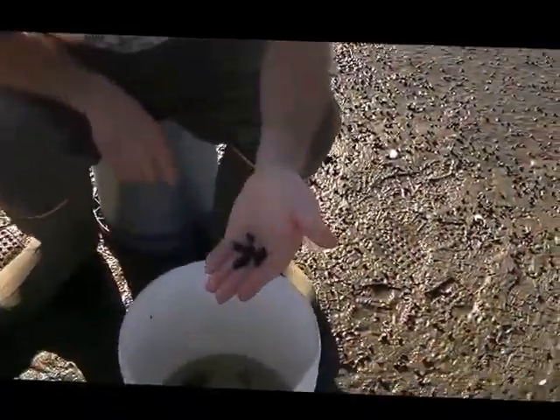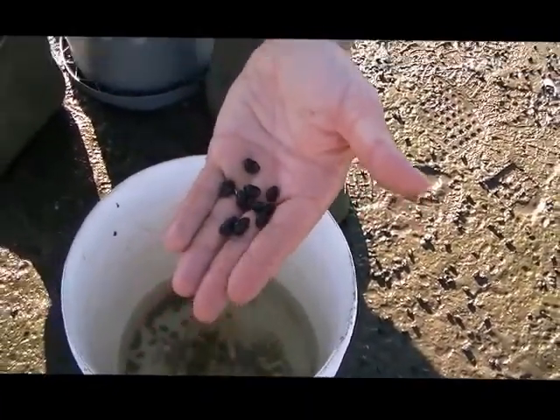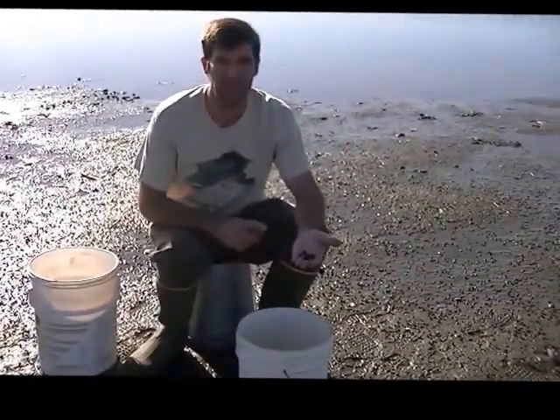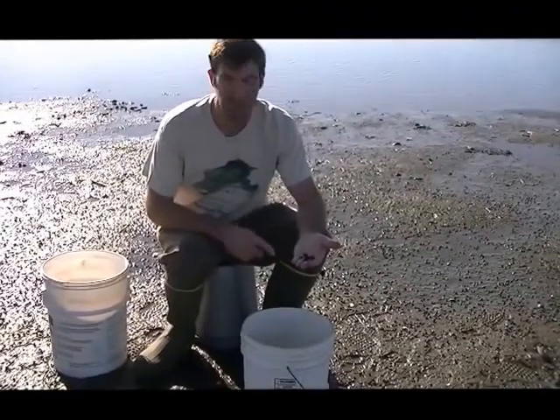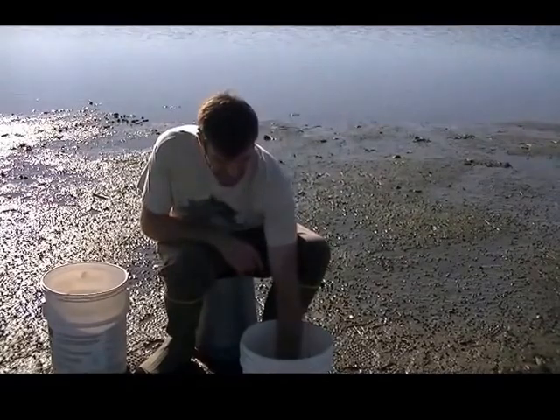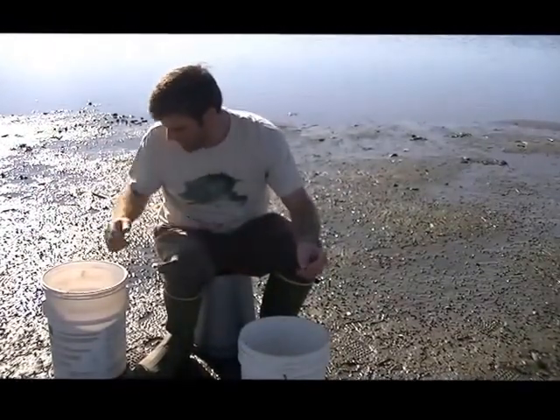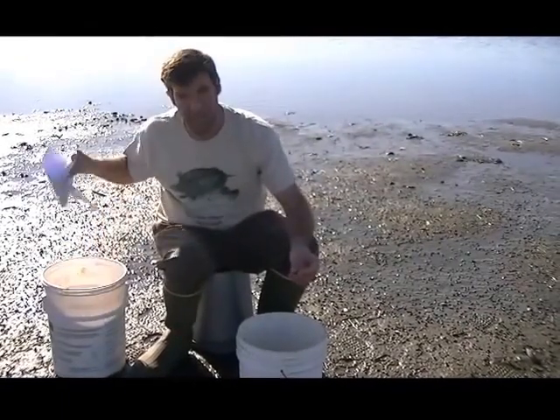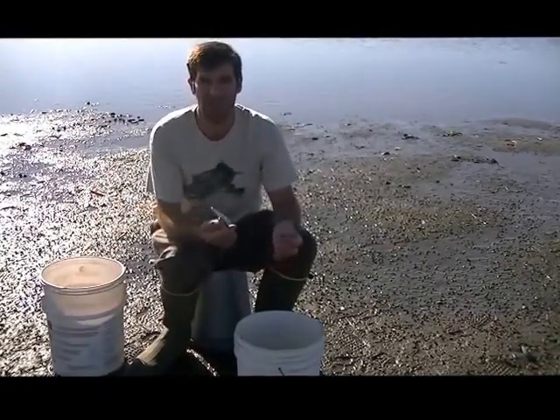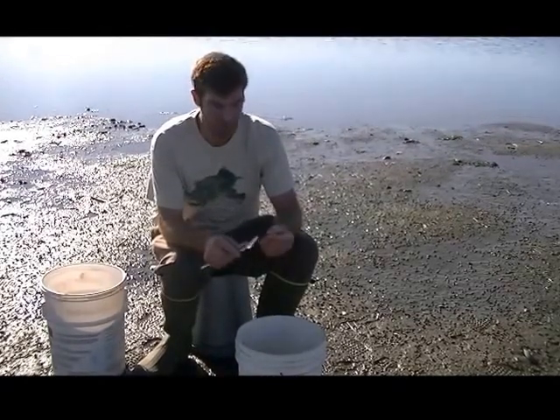Okay, so here we are, and we're examining the snails now that we've collected for the cysts of the trematode parasite. So we want to measure a couple things about the snails first, and then we'll examine the snails for the actual parasite. So we're going to take these snails one at a time, and it's good to have a little bit of the water in the bottom of the bucket, the seawater, so you can rinse them off. And we're going to have our data sheets handy, and also something to measure them with. You could use calipers like this, or you could use a millimeter ruler if you don't have calipers.